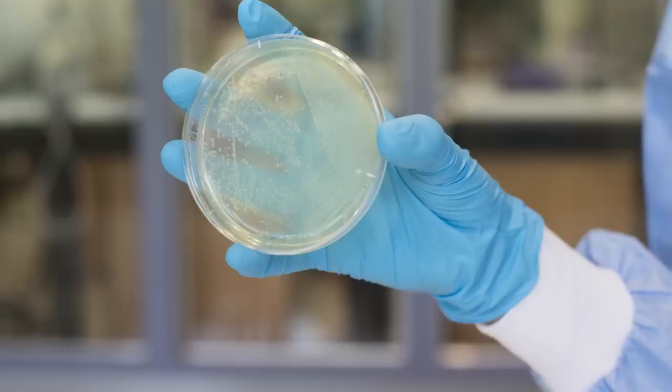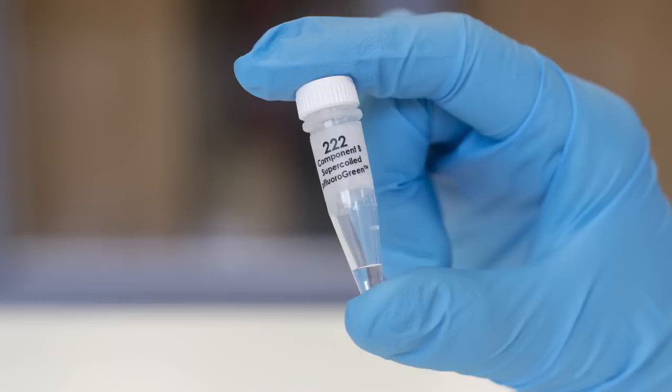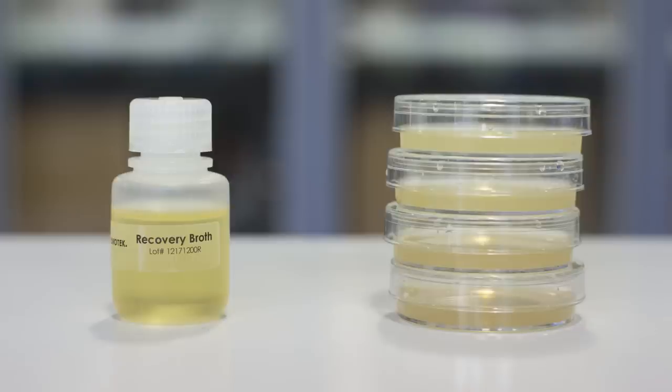Edvotek instructional videos: transformation. For this experiment you will need an E. coli source plate, a tube of plasmid DNA, nutrient media plates, and recovery broth.